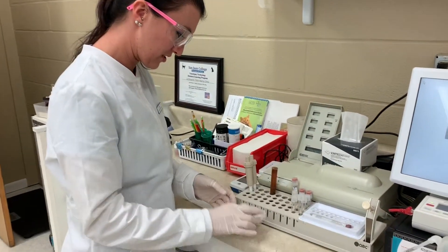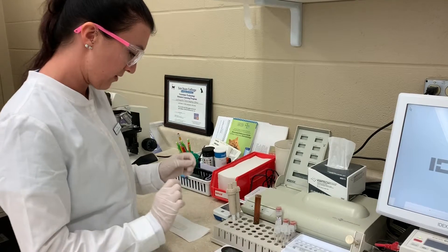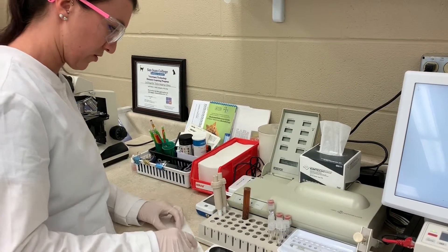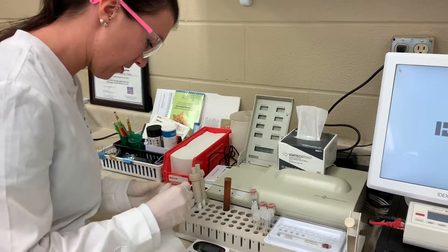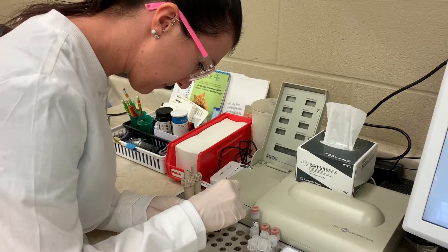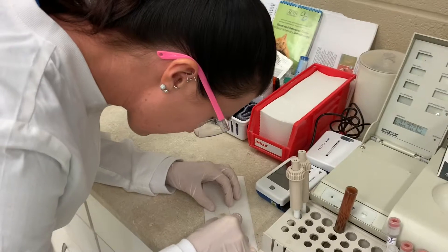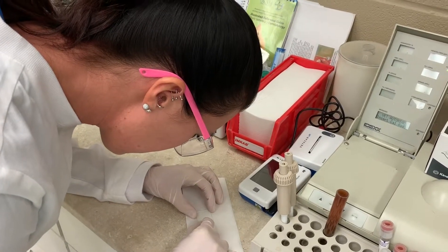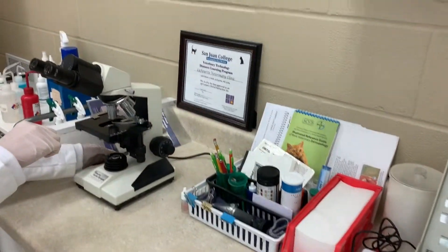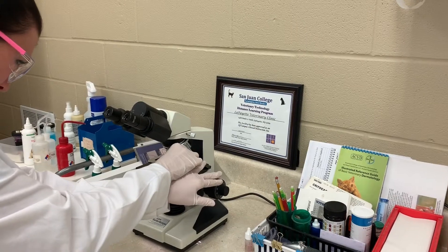We're back and the timer is going off — it has been 15 minutes. It's been sitting on the meniscus for 15 minutes. The next step: I'm going to take this cover slip off and place it on a microscope slide. Okay, so we'll place that down.